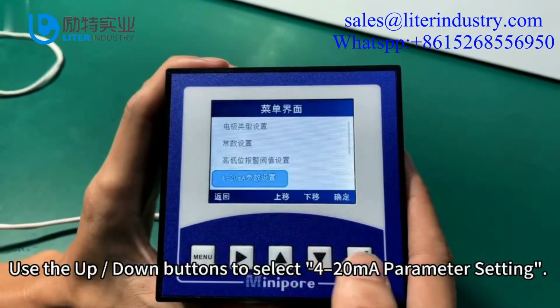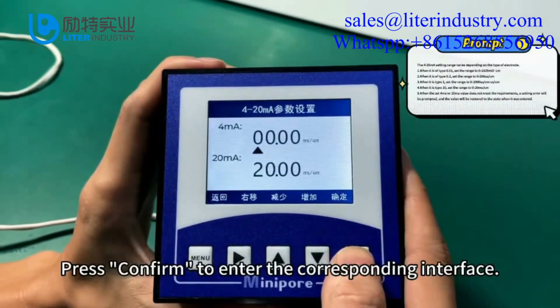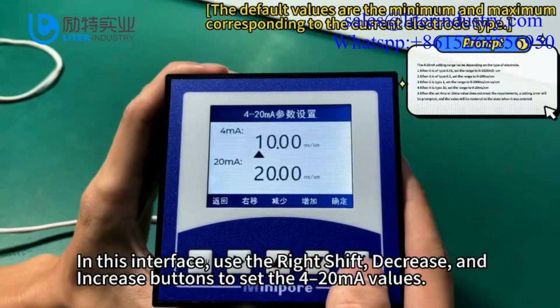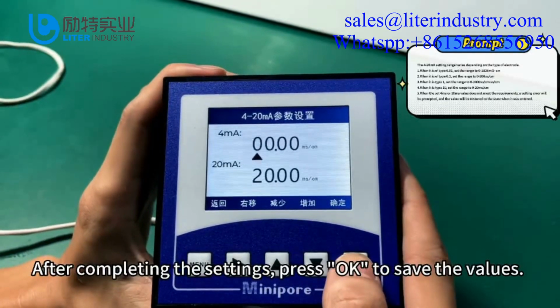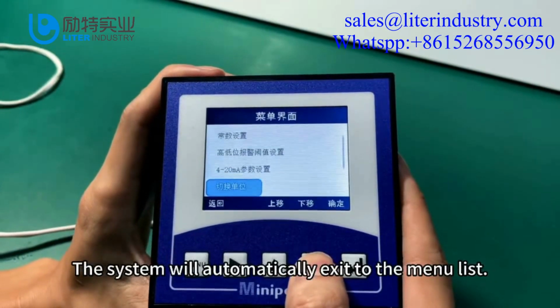Use the up-down buttons to select 4 to 20 mA parameter setting. Press confirm to enter the corresponding interface. In this interface, use the right shift, decrease, and increase buttons to set the 4 to 20 mA values. After completing the settings, press OK to save the values. The system will automatically exit to the menu list.